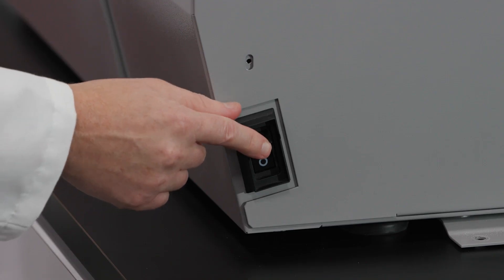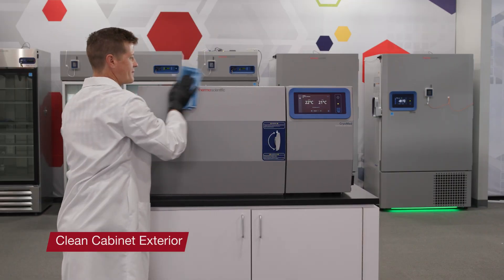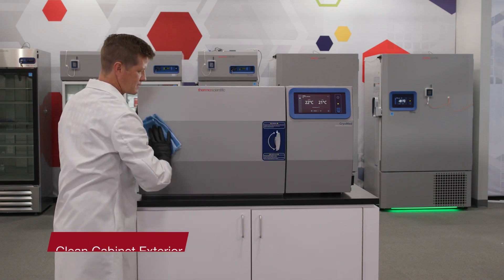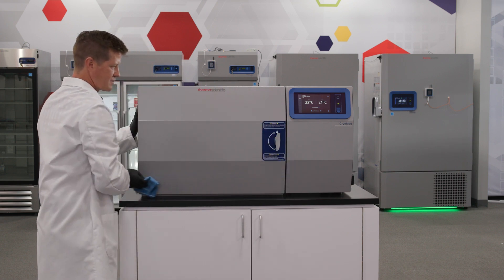Plug the freezer in and turn the power switch on. Clean the freezer exterior with a damp sponge or soft well-wrung cloth and mild detergent dissolved in water. Dry with a soft cloth.